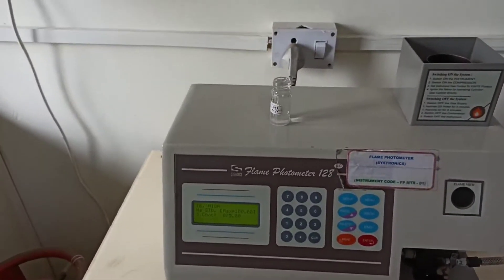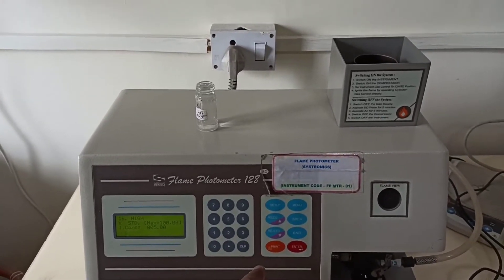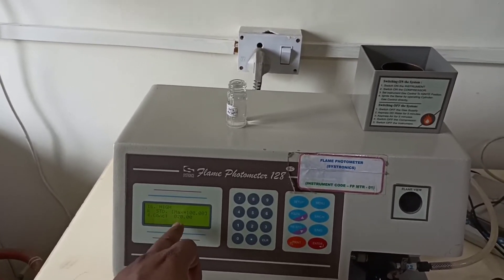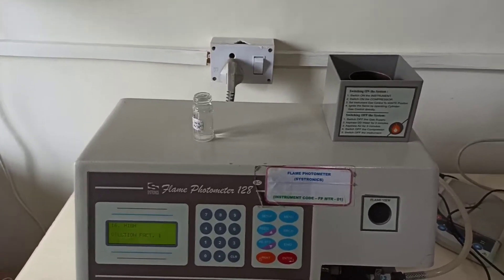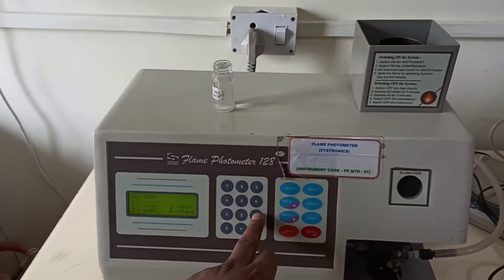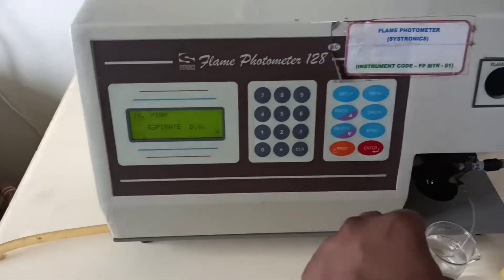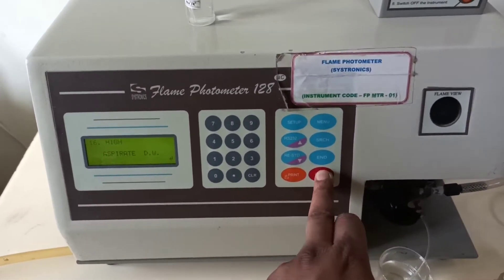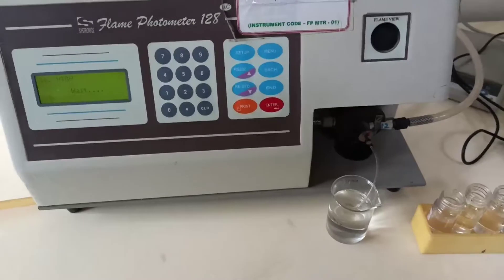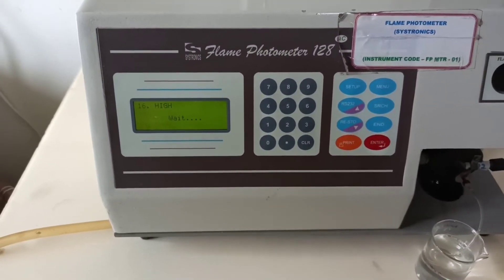I will tell you how to prepare the standards in detail in another video. For the first standard, as I told you, we take 100 for sodium concentration and 20 for potassium. In the second standard we take 75 sodium and 15 potassium. In the third standard, 50 sodium and 10 potassium. And the last one is 25 sodium and 5 potassium. So the concentration of sodium is higher and potassium is lower across all standards.